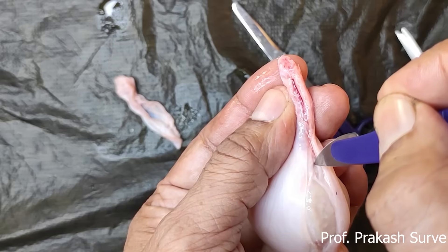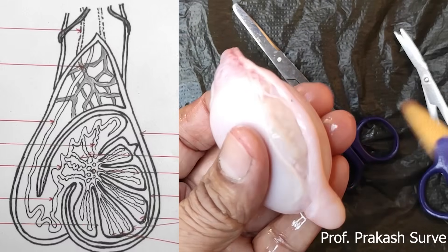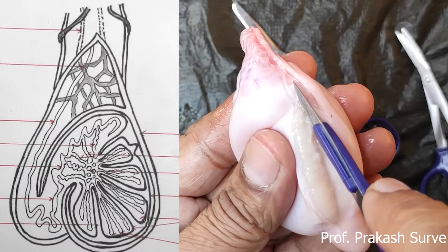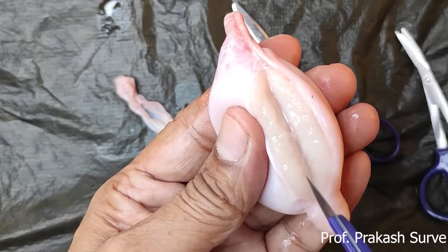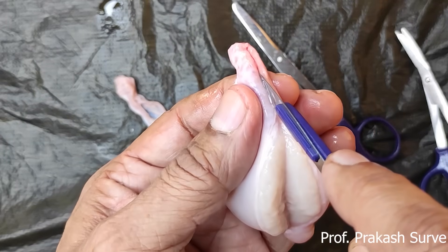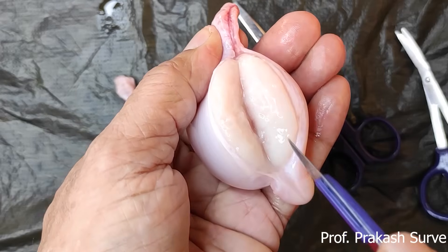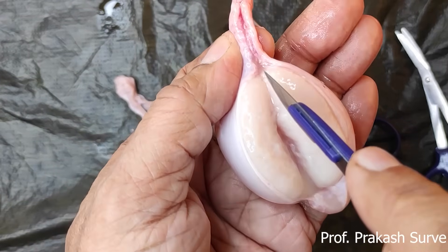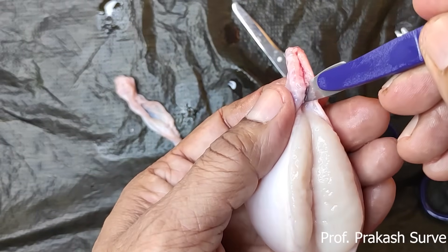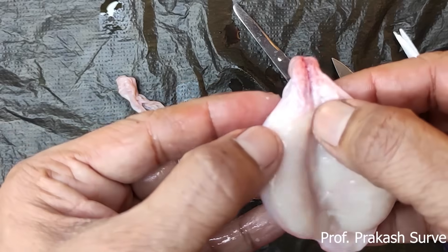Each of these testicular lobules shows one to four highly coiled seminiferous tubules. Inside the seminiferous tubules, there are many spermatogonia. Here, slowly, we will take the first longitudinal section of the testes. Here are many seminiferous tubules present inside, where the formation of the sperm takes place. About the spermatic cord — we can find a number of structures in the spermatic cord.